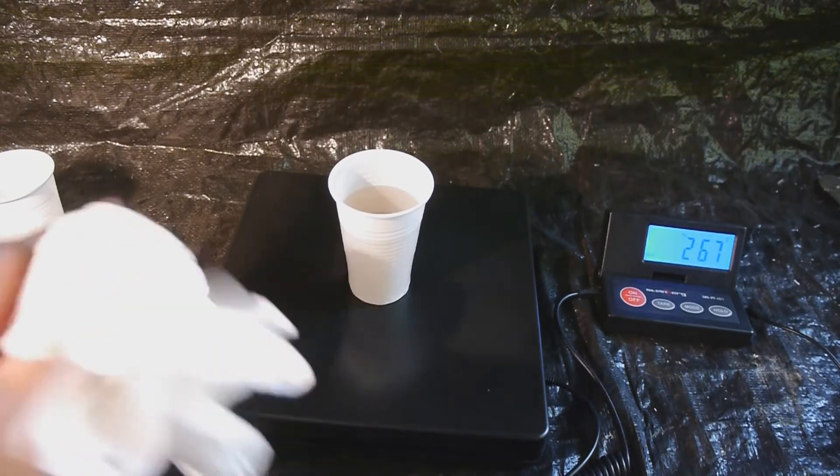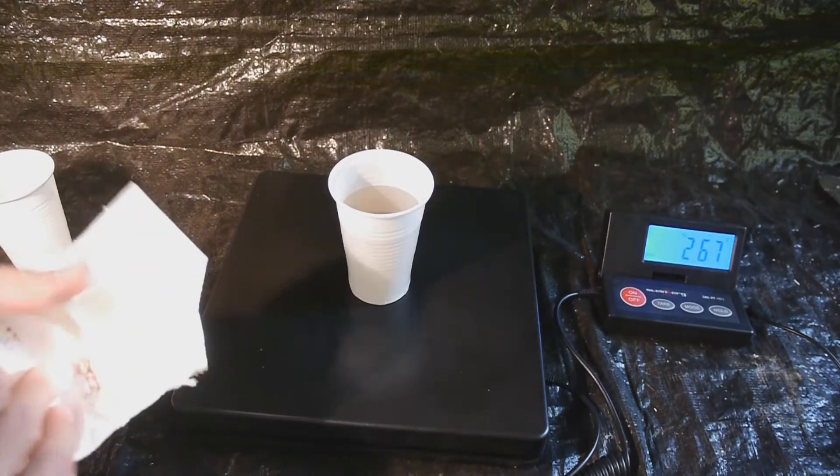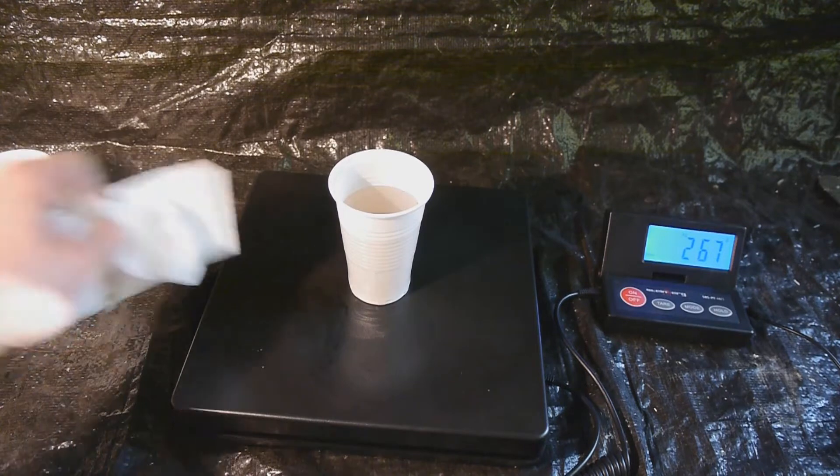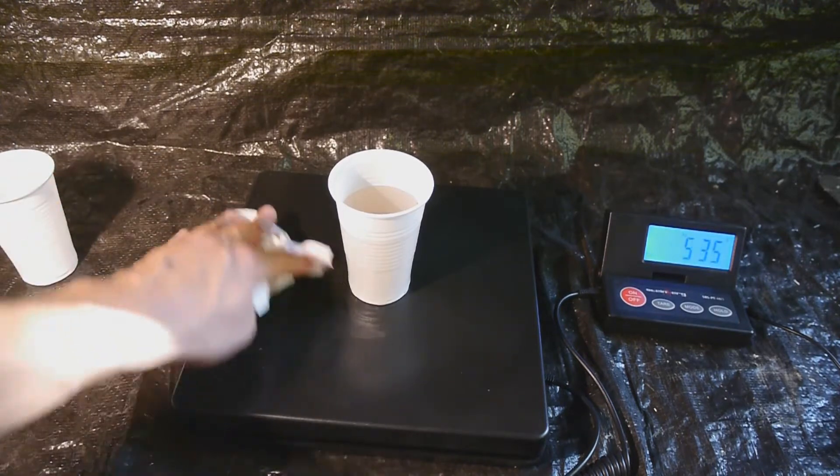Oh my gosh, paper becomes quite hot when you wipe concentrated sulfuric acid with it. That scared me. I've got concentrated sulfuric acid on my hand. Fantastic.